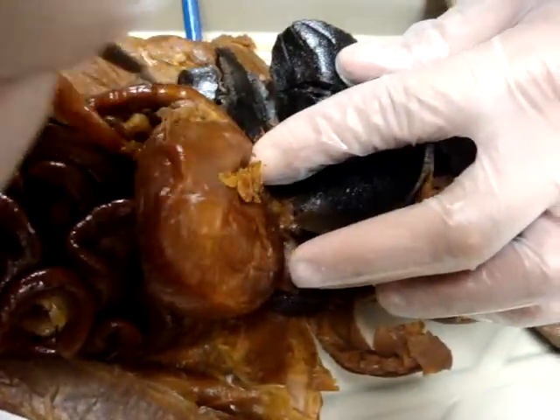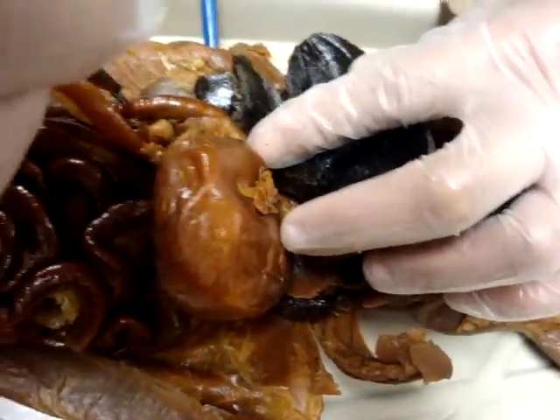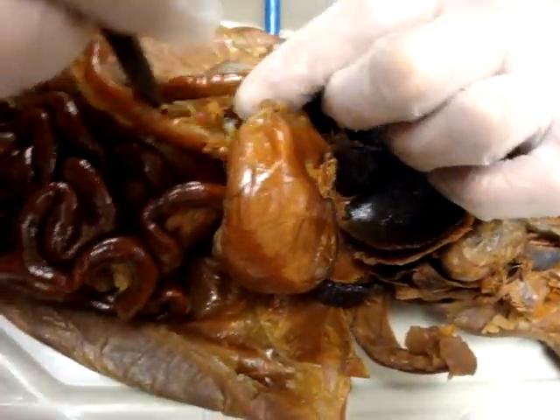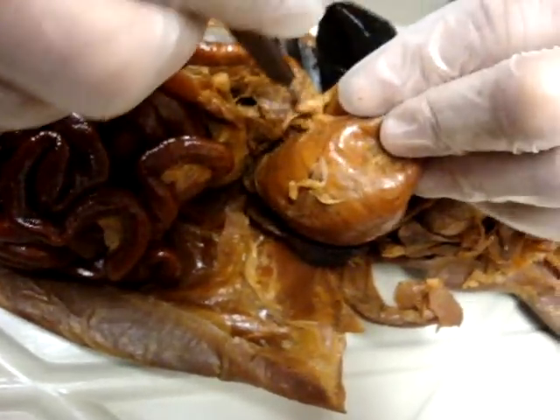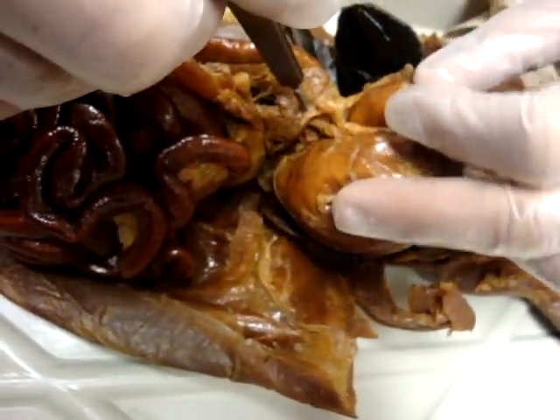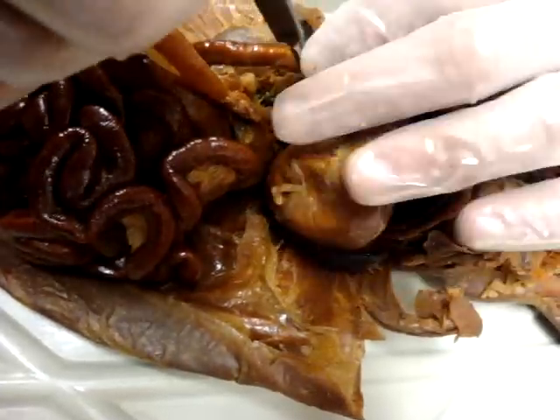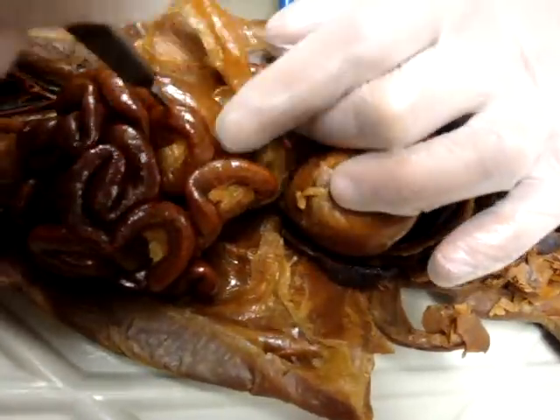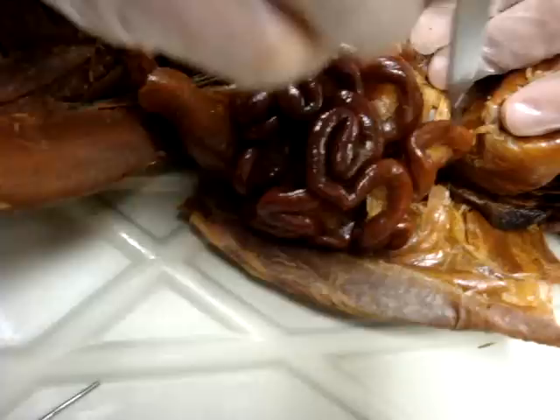Going into the small intestine — the duodenum. Right here is the pancreas, connected to the duodenum and the stomach. Going down into the duodenum is the jejunum, which is part of the small intestine.